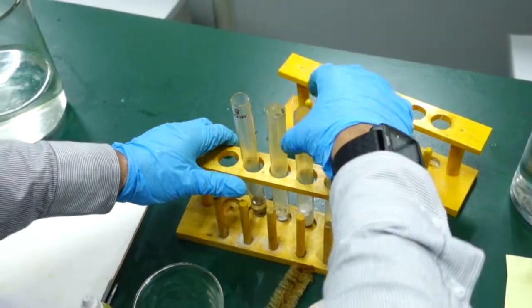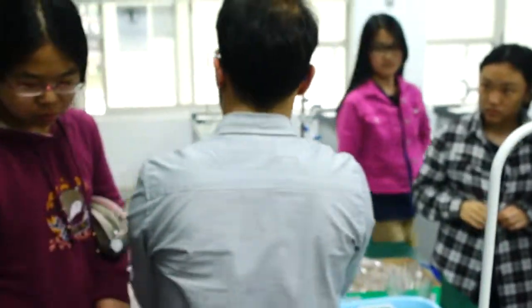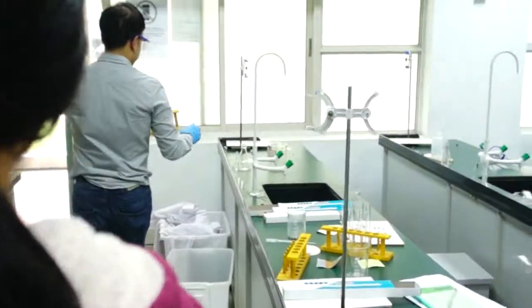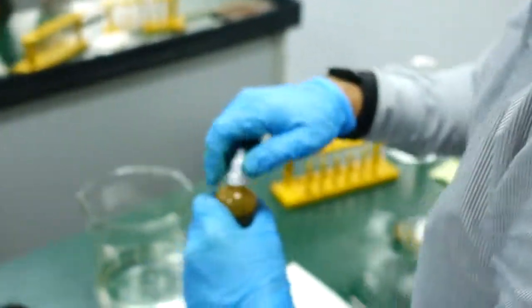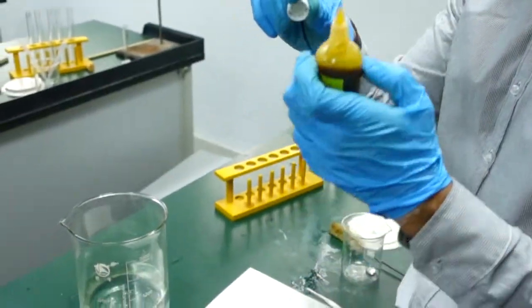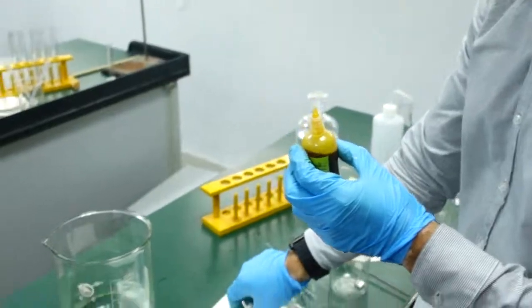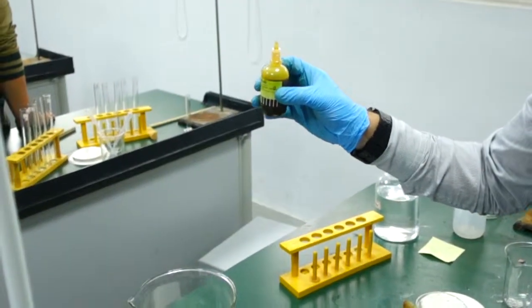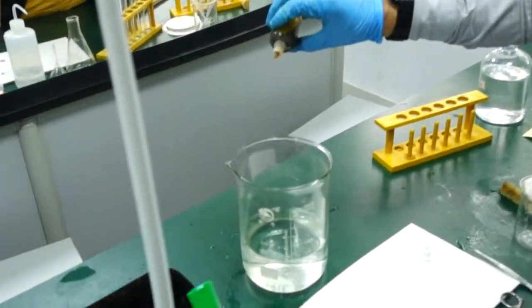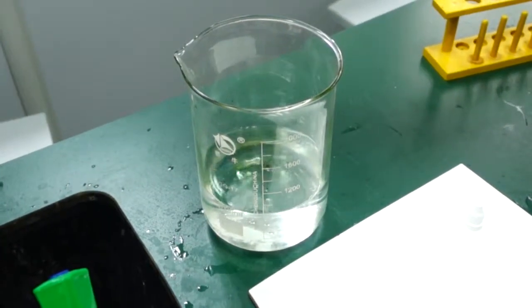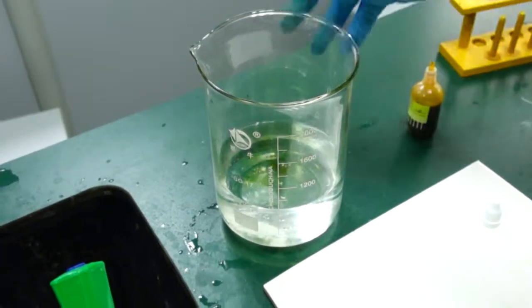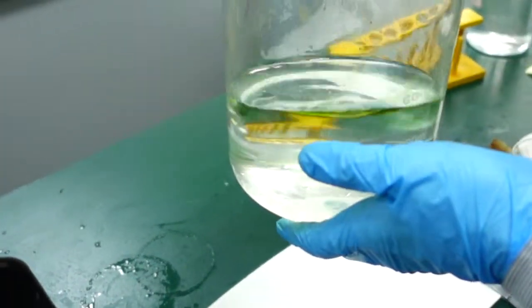We've got two more metals to see, X and Y. Well, first of all I have some water here and some universal indicator. What color do you think it will go? Green? Any other ideas? Neutral - green is neutral, yes. Okay, water, just water.